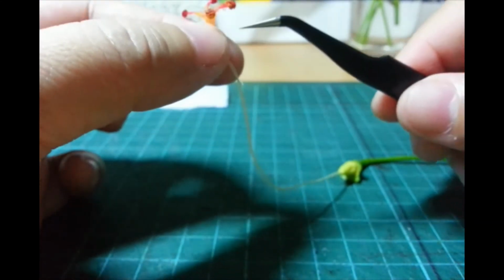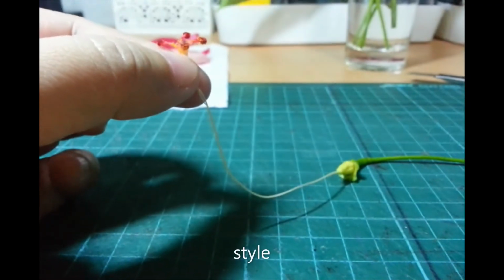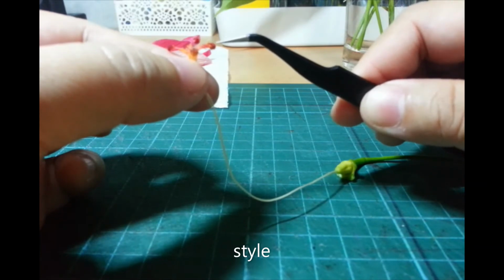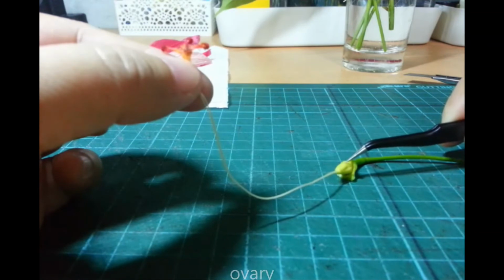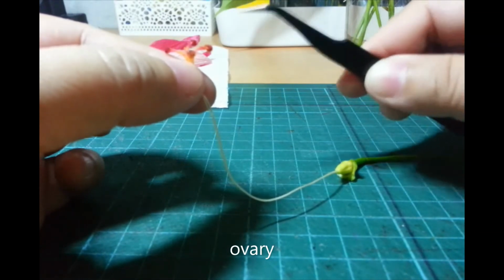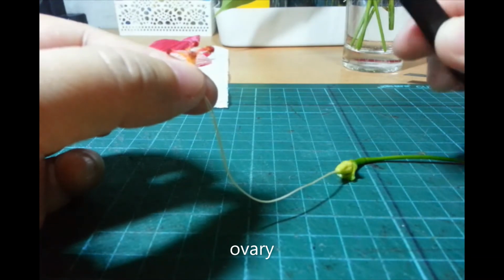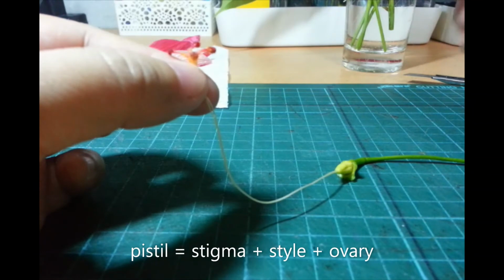Pero, kailangan niya mag-travel down the tube, and this tube here is called the style. Okay? So, stigma, style, kasi nandito yung ovary, where the eggs are. Okay? So, that's the whole female part. This is called the pistil. Okay? So, remember, yung sa male, stamen ang tawag. It's made up of filament and the anther.